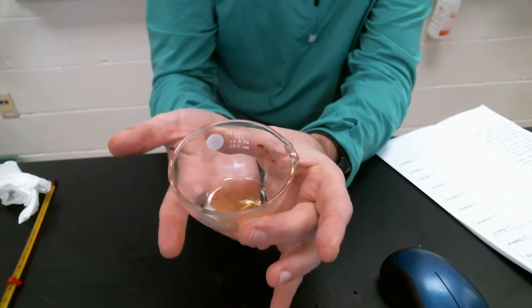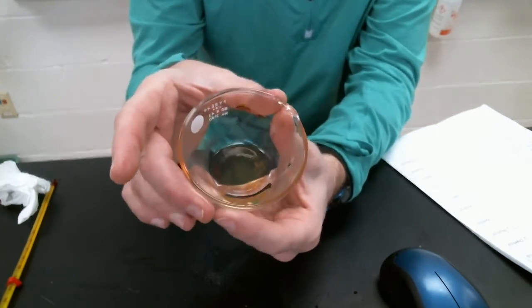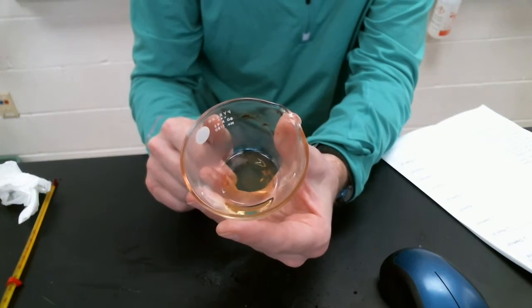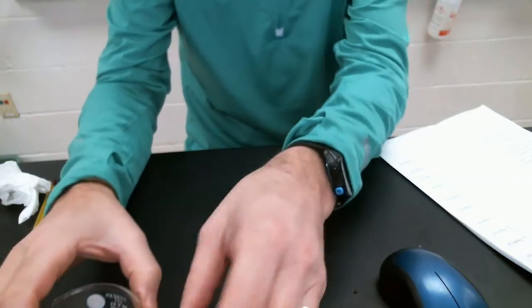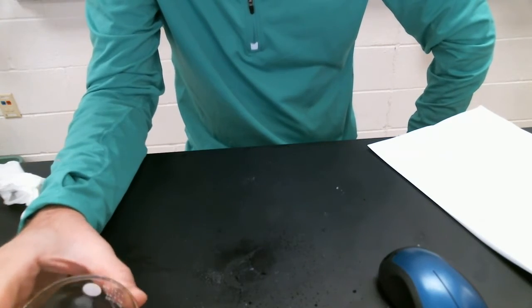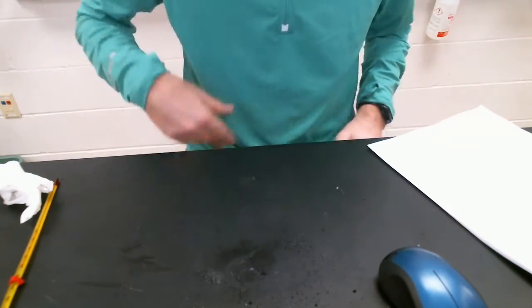And then what you're missing, guys, is that it is also really hot to the touch. So it bubbled, it fizzed, it was hot to the touch. So what do we think? Chemical or physical? If you said chemical, you would be correct. We actually had that magnesium and the hydrochloric acid react. The gas that was produced was actually hydrogen gas, but definite chemical reaction.